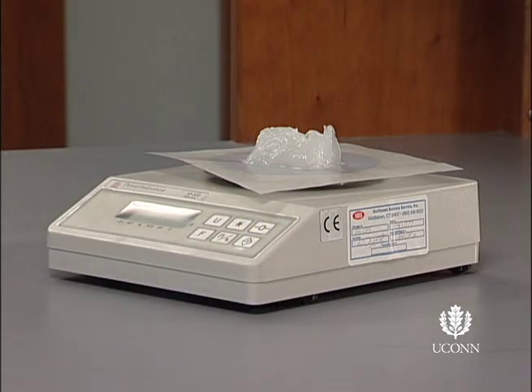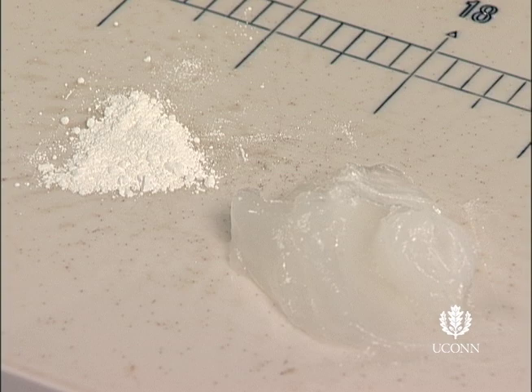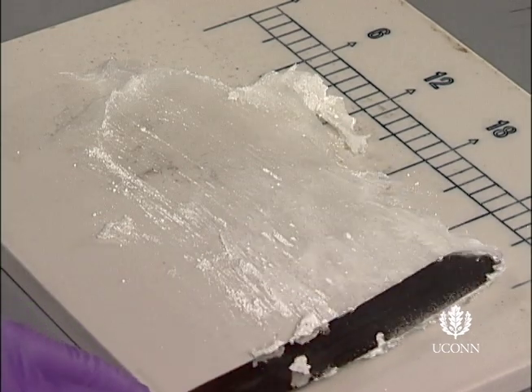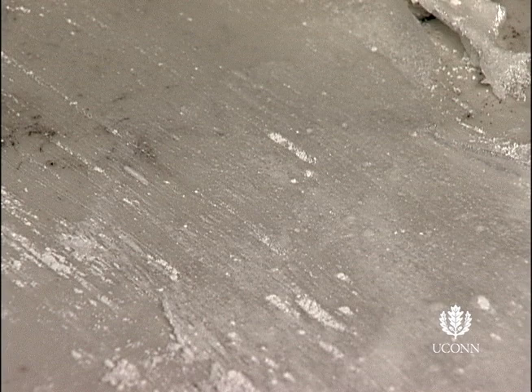Begin the lab by weighing out appropriate amounts of base and powdered components, including one or more drugs. Transfer the powders to the pill tile. As you will see, solids are not easily incorporated into ointment bases. Breaking up agglomerates in the powder of the solid dosage form is key when combining the powders and base.